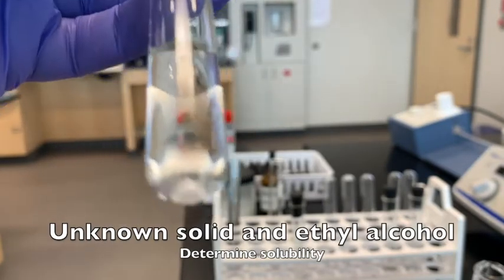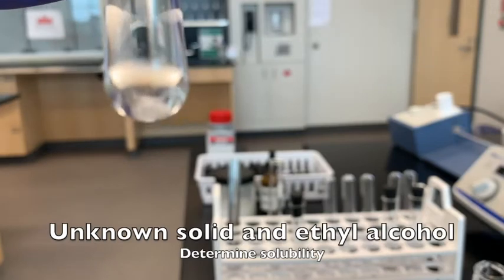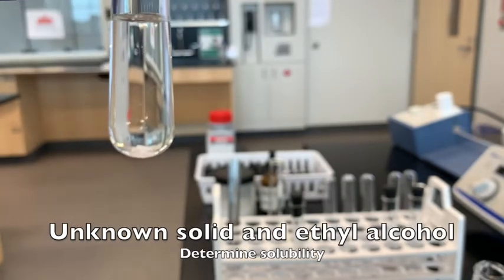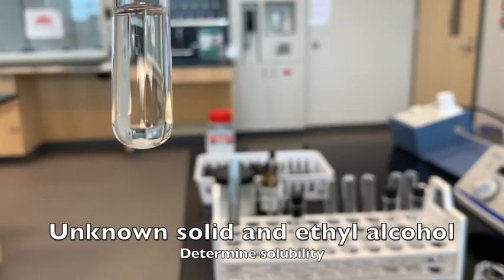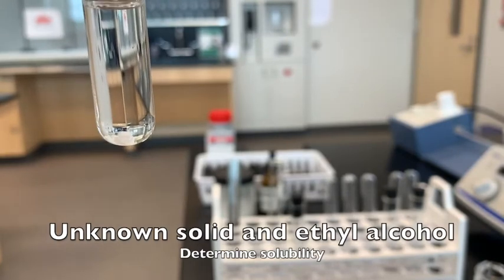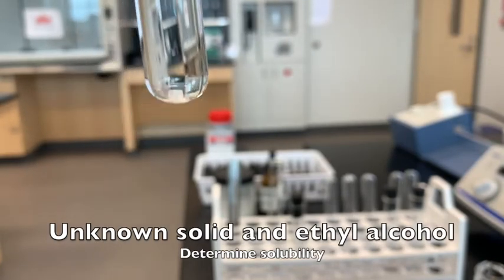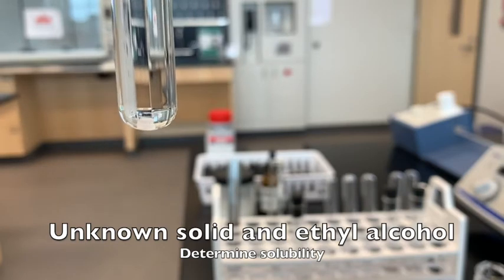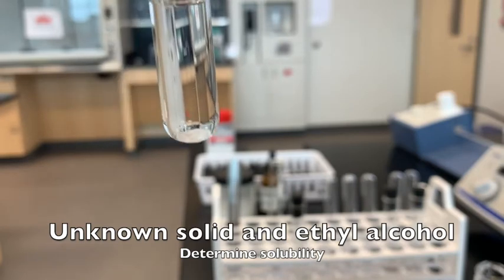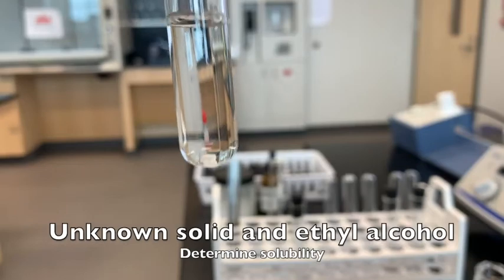Here is the test tube of ethanol and the unknown solid. You can decide whether it's soluble, insoluble, or partially soluble. I would say the solid in there at the bottom is a little less than what we started with, but there is definitely still solid inside the test tube. So this is the unknown solid and ethanol.